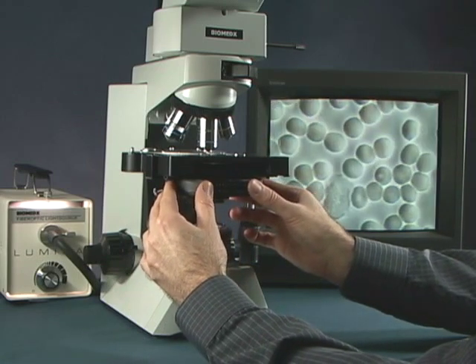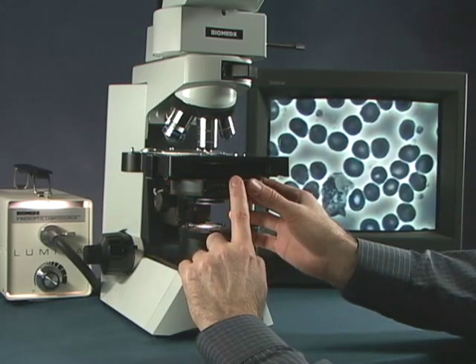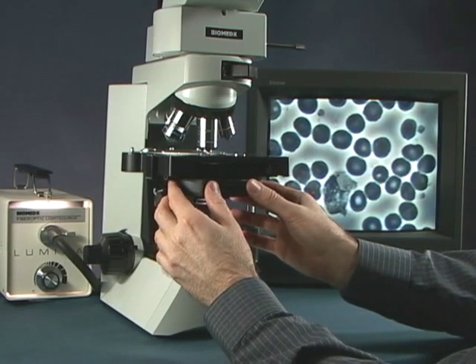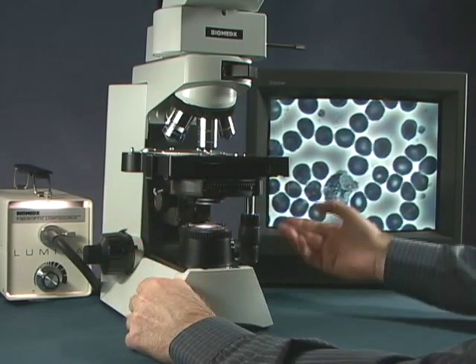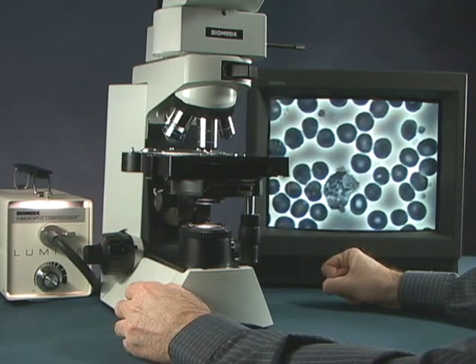And that's what we did here to make it look like this. But assuming that the turret is in the right indent and it is adjusted and if we still have an image that isn't fine and high contrast, then we actually have to adjust things.